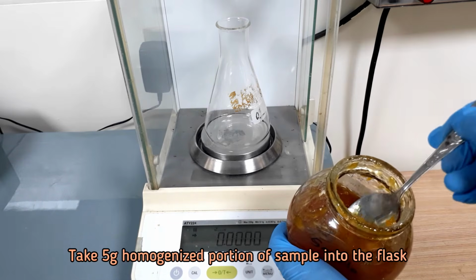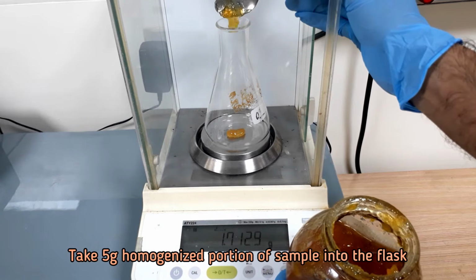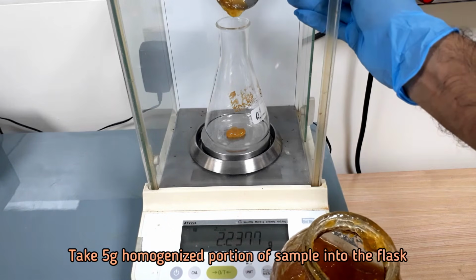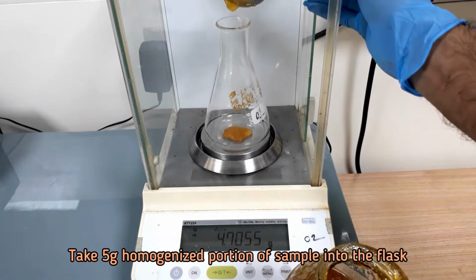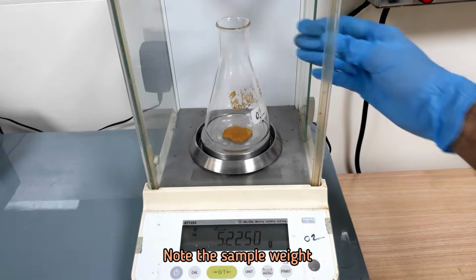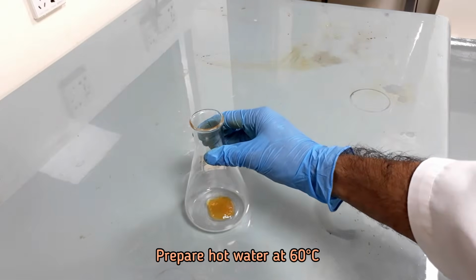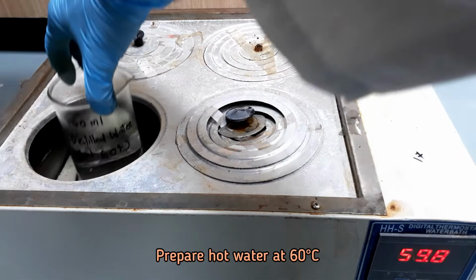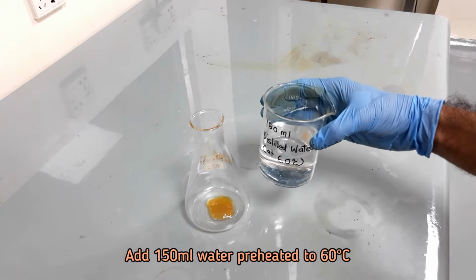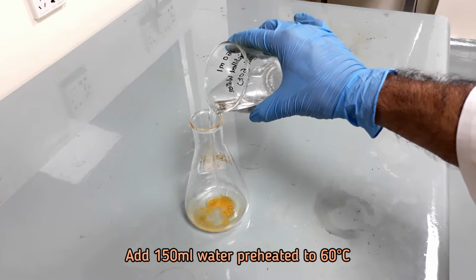Take 5 grams homogenized portion of sample into a conical flask. Note the sample weight. Prepare hot water at 60 degrees Celsius in water bath. Add 150 ml water preheated to 60 degrees Celsius.